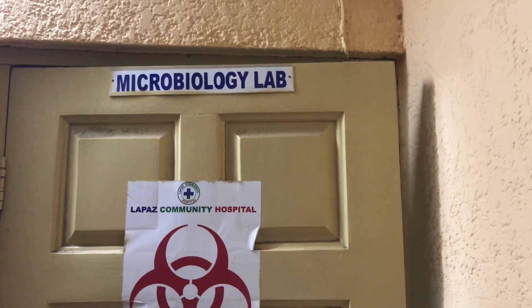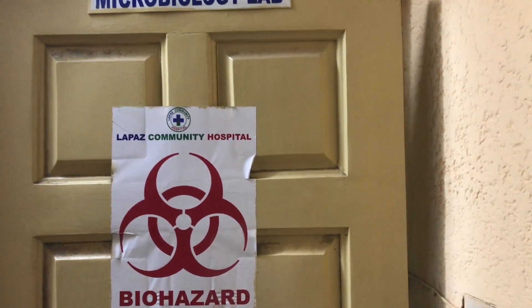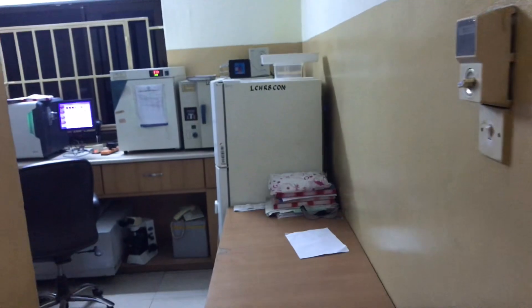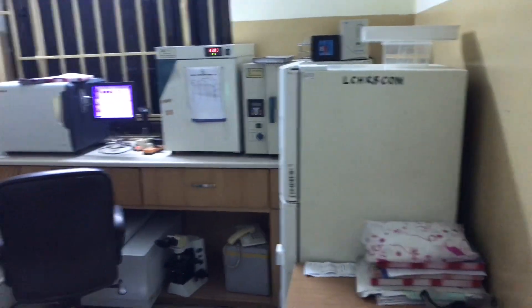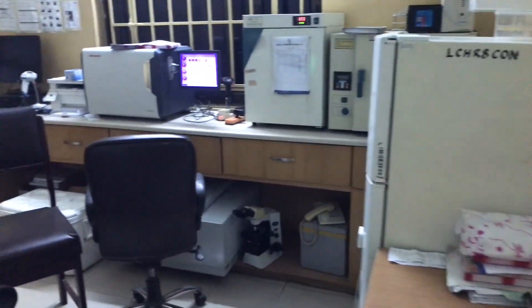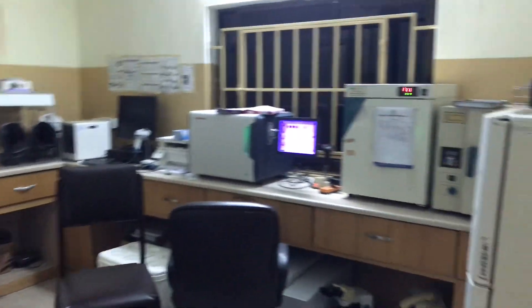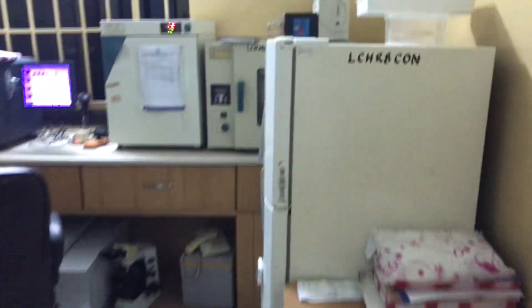Hello! In this video I want to quickly give you a 360 of our microbiology lab. So, there's the microbiology lab in a long view — this is how it looks like.